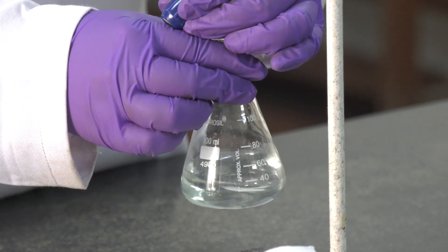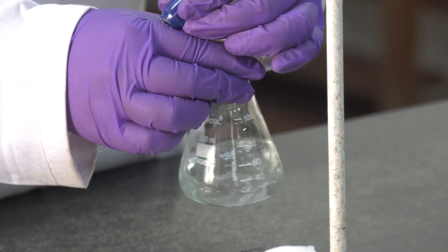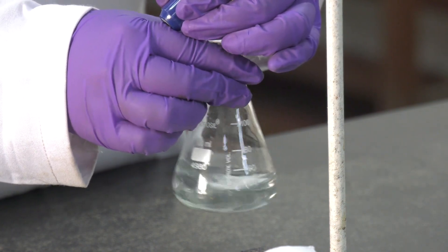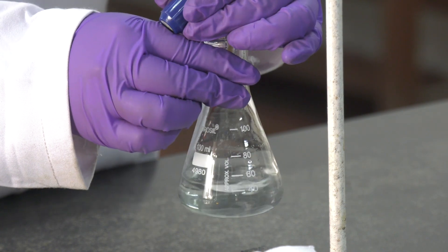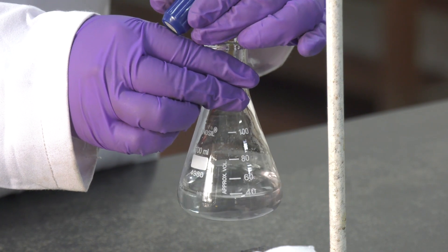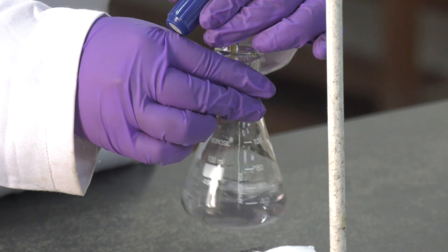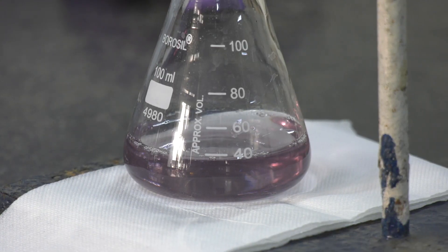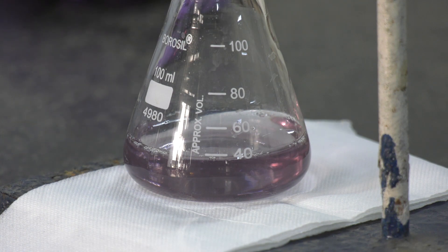The appearance of green colour is due to the reduction of dichromate into chromium(III) ions in the presence of acid. To determine the end point, add the solution from the burette drop by drop and the pale green colour will change to purple at the end point. We can see the colour has changed from green to purple and the end point for this titration is achieved.